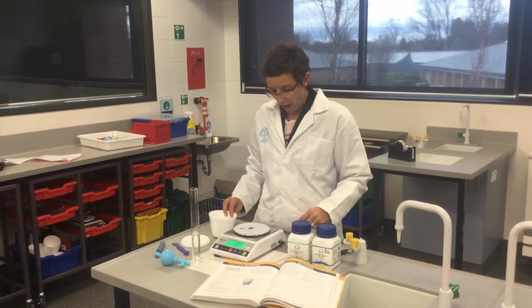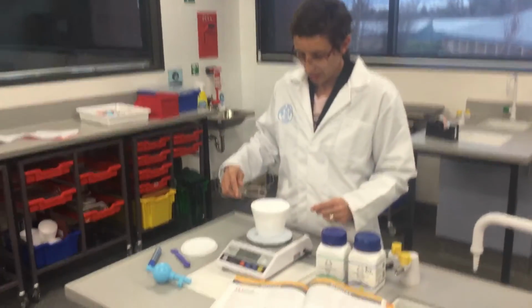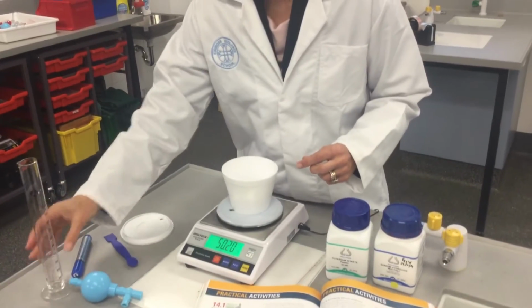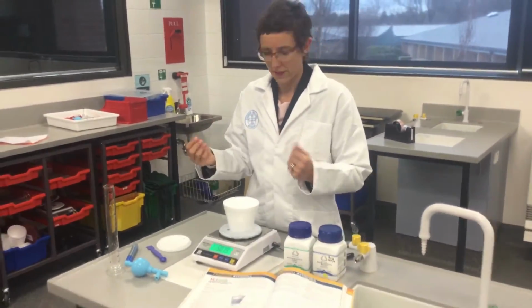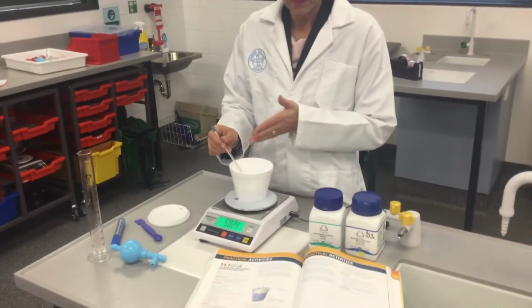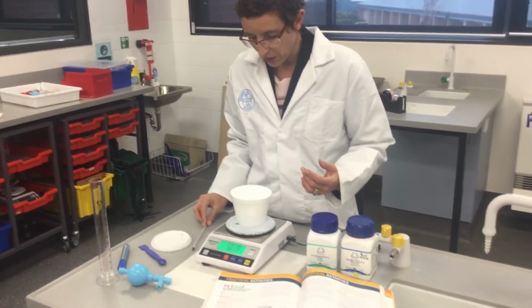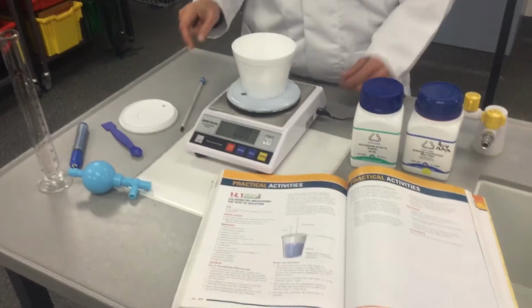We're going to start by measuring 50 mL of water, and that's our solvent, and we're just going to simply pour it into our polystyrene cup. We're using polystyrene because it's a good insulator. Hopefully we won't lose lots of heat out of it. We're then going to measure the temperature, and we'll wait until the temperature gets to a stable reading after about 5 minutes.